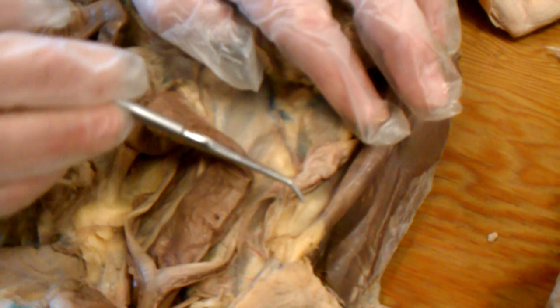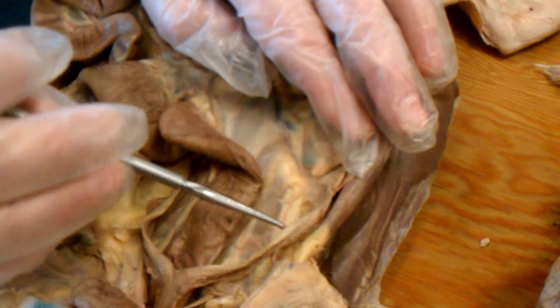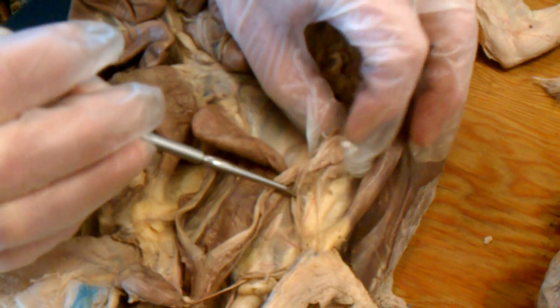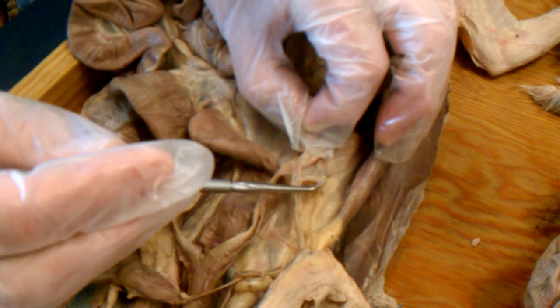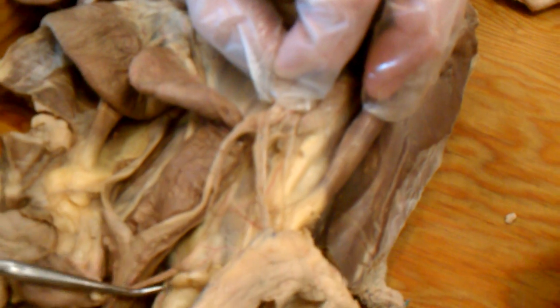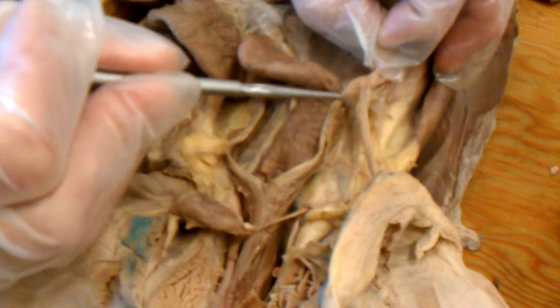The uterine tube ends at this point, and empties into an enlarged tube, the horn of the uterus. On this cat, it's been torn and it's not really very visible, but all along the length of the uterine tube, there was originally this membrane or mesentery holding it to the dorsal body wall, and since it went all the way along the length, it got the name broad ligament.